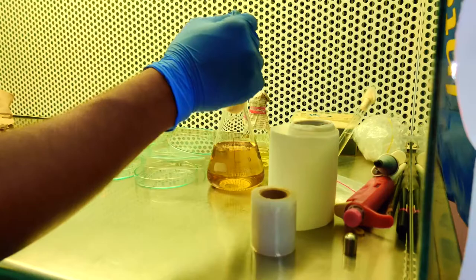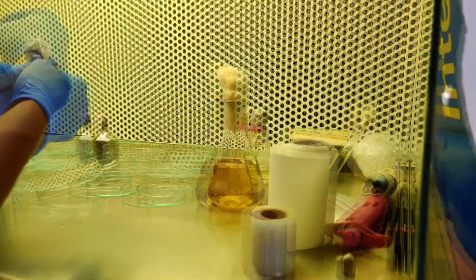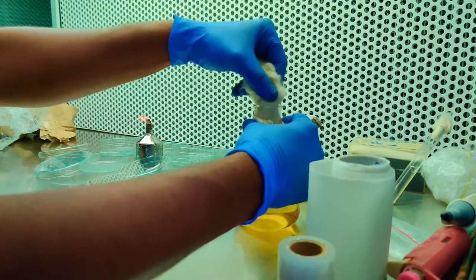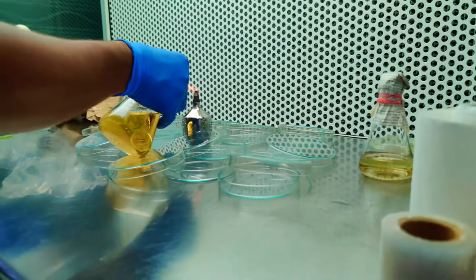I'll screw it up because if there are any fibrils attached, that also will adhere to the cotton plug. This paper, the same paper, is very hot so I cannot hold it. I just made some support to keep the hotness away from my hand so that I can pour complete media.